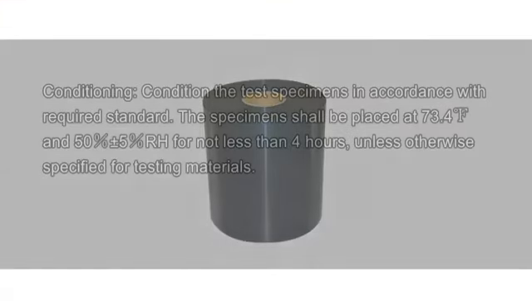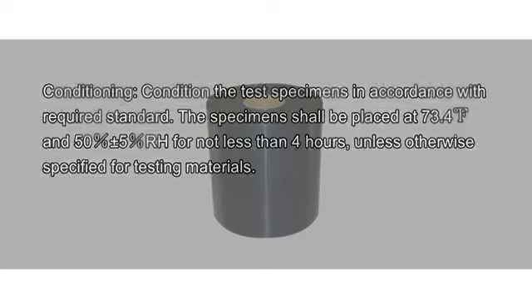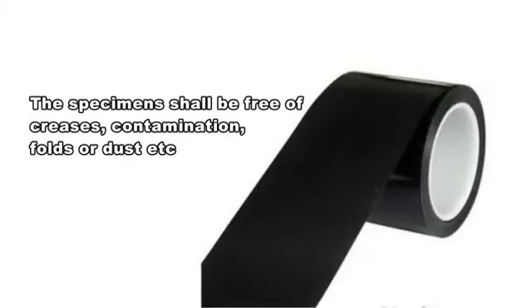Conditioning. Condition the test specimens in accordance with the required standard. The specimen shall be placed at 23 plus or minus 2 degrees centigrade, that is, 73.4 plus or minus 3.6 degrees Fahrenheit, and 50 plus or minus 5% relative humidity for no less than 4 hours, unless otherwise specified for the testing materials.